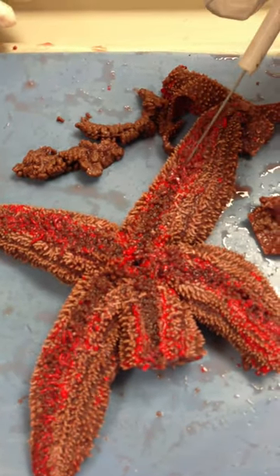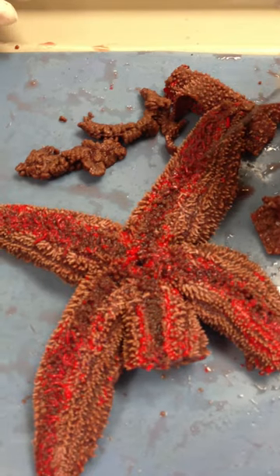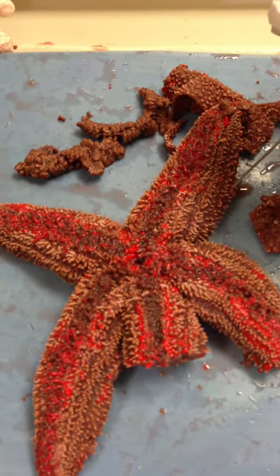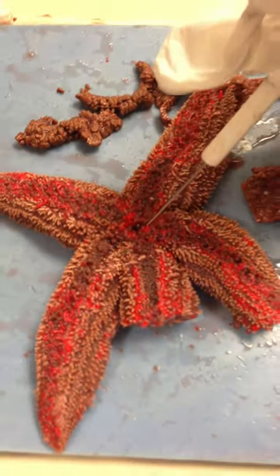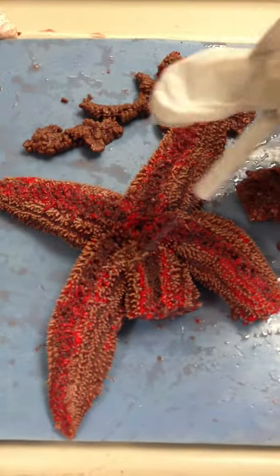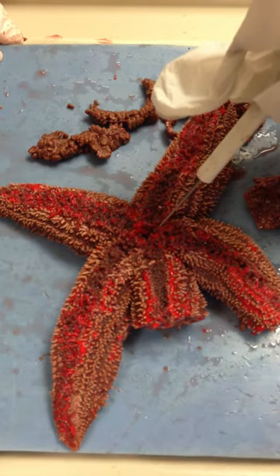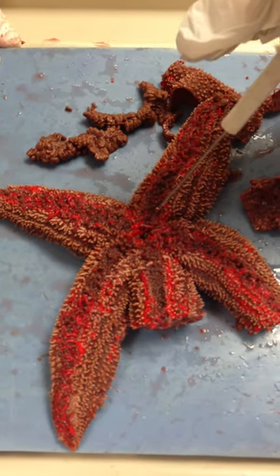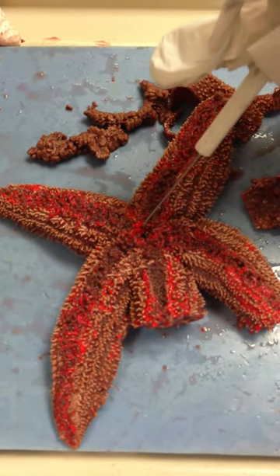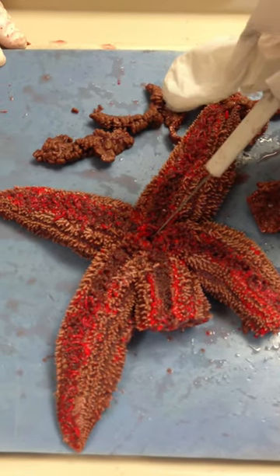You can also see on this side all of the tube feet. These are the spines, and these are also known as pedicellaria. This is where the mouth region is. So this side would be the oral region, and the stomach located closest to the mouth on this side is the cardiac stomach. So let's flip it back over again.